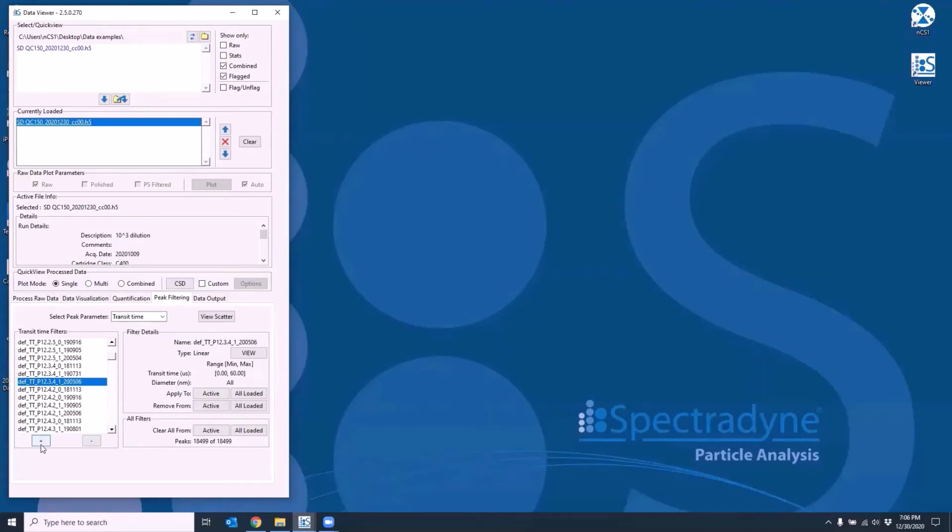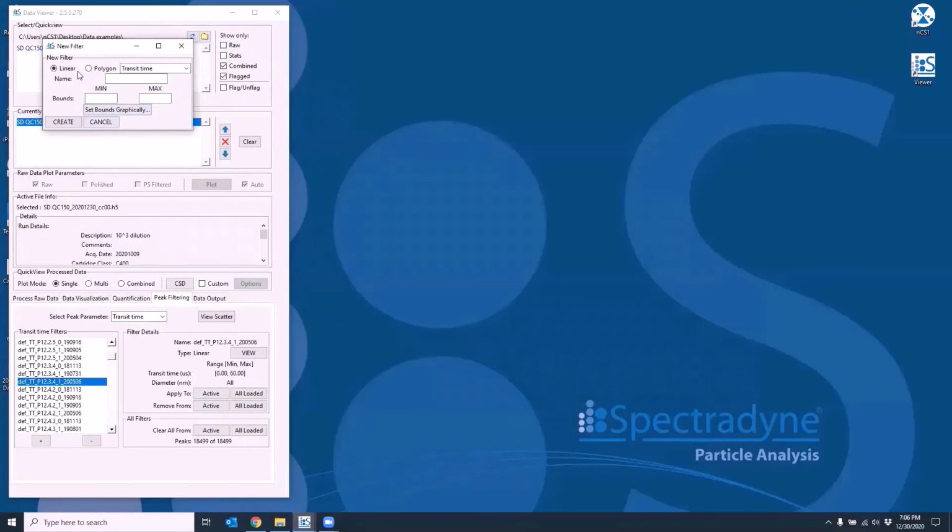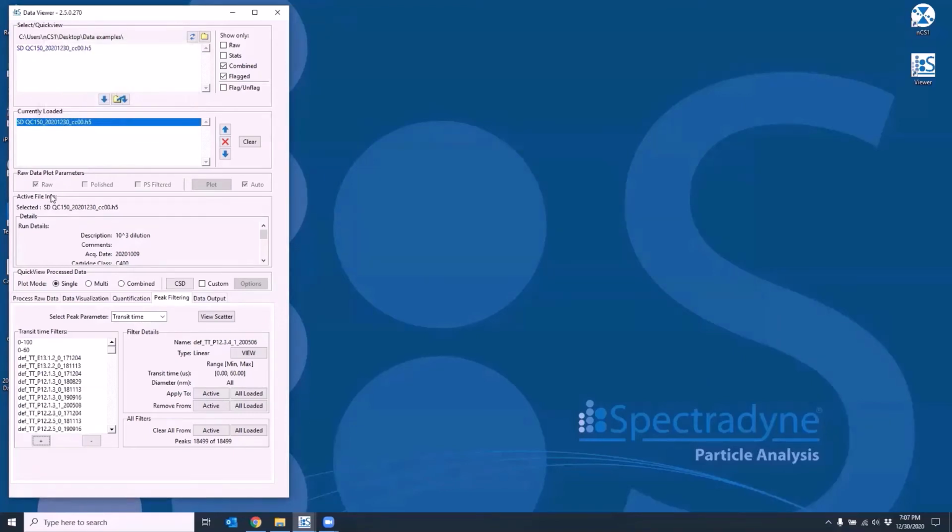Choose one of the two options for the type of filter. The two options are linear or polygon. Linear will apply a filter bound with constant value, and polygon filter will apply 2D user-defined polygonal boundaries. The drop-down list allows you to select from any of the 4 parameters. So let's create a linear filter in transit time. We can specify a descriptive name for the filter. So let's say we want to create a transit time filter from 0 to 100. Enter the bounds of minimum 0 and maximum 100, and click Create.